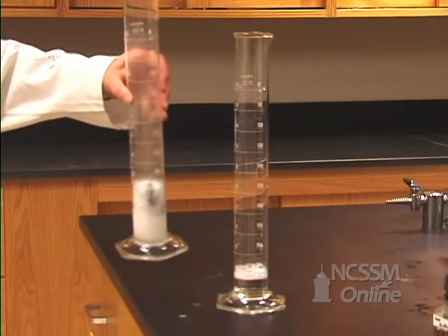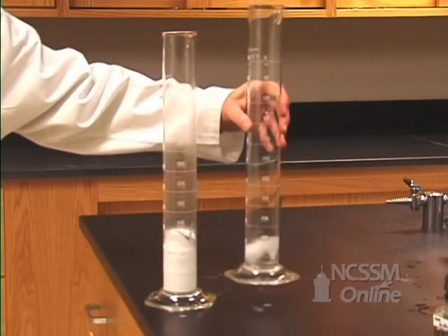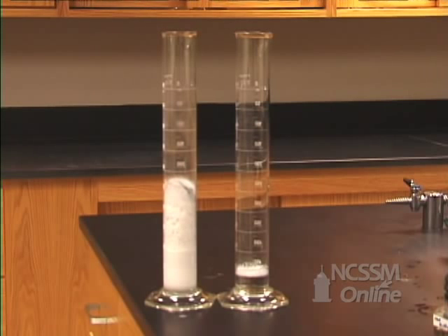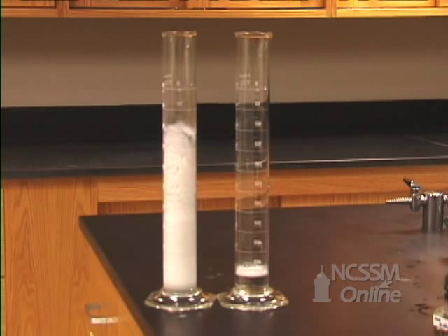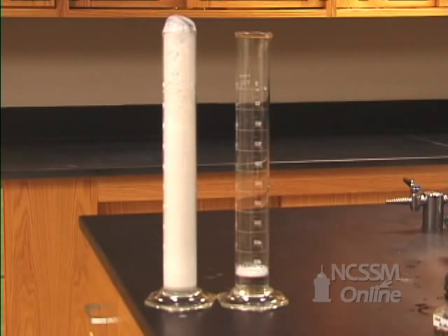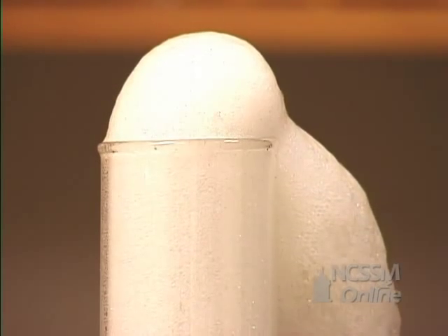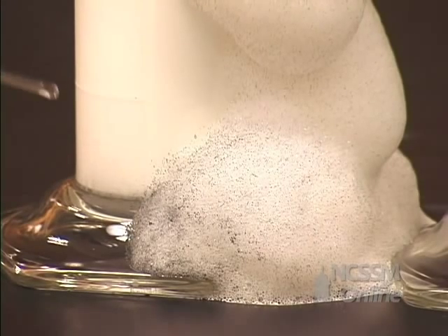I'm going to stir it just a little. I'll do the same to the other. Here we go. If you look closely, you can see little flakes of the manganese dioxide.